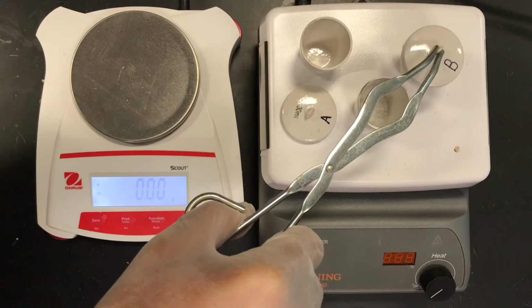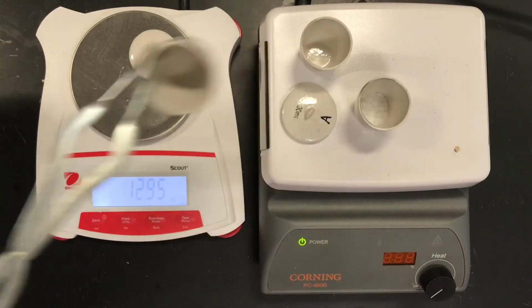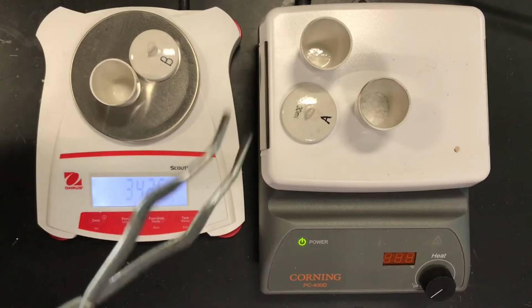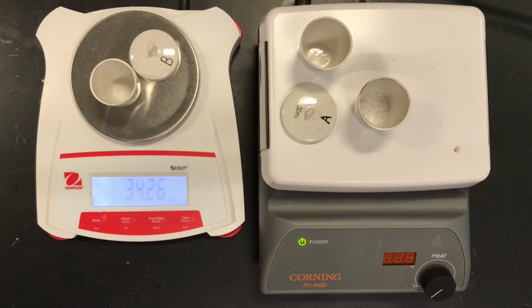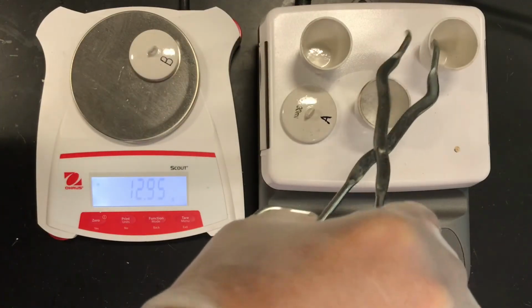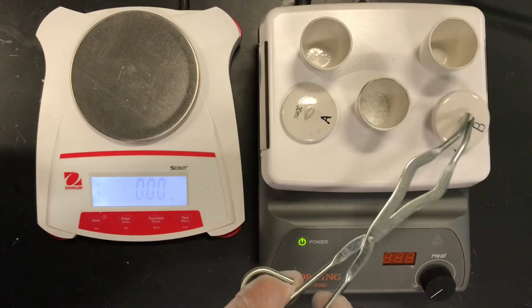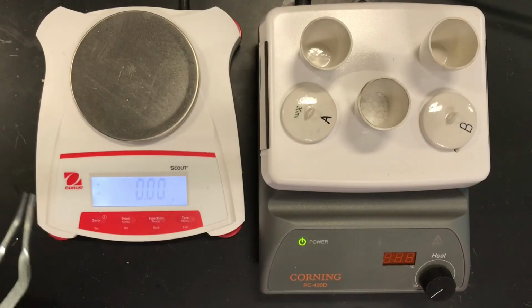And we'll do student B. Again, pick one or the other. I'm using the middle crucible when we heat it to be the reference point. And we have the mass there. Okay? And so I know I could have kept that there, and we could have tared out the weight. I could have put the crucible on here and hit re-zero.